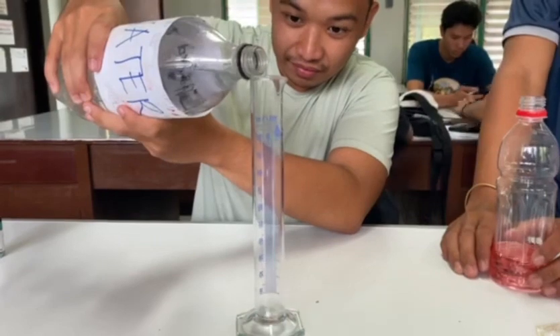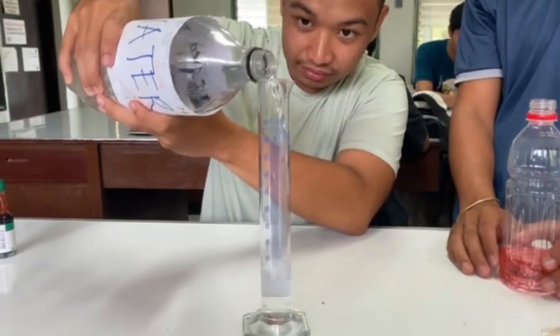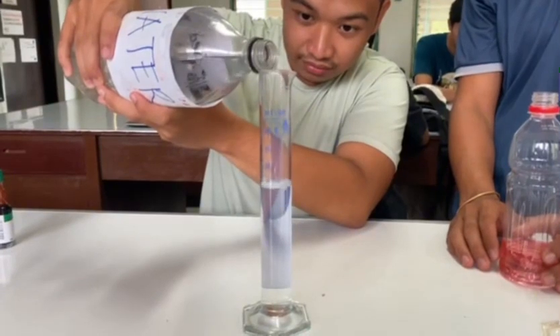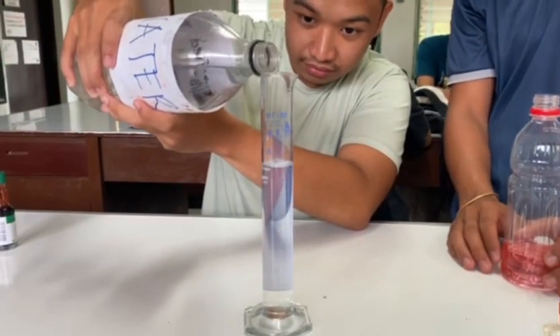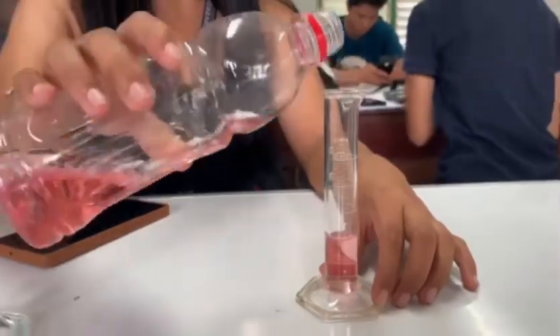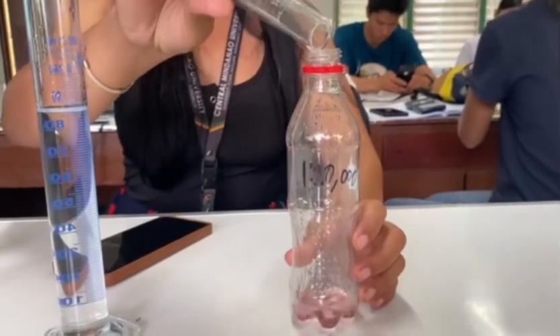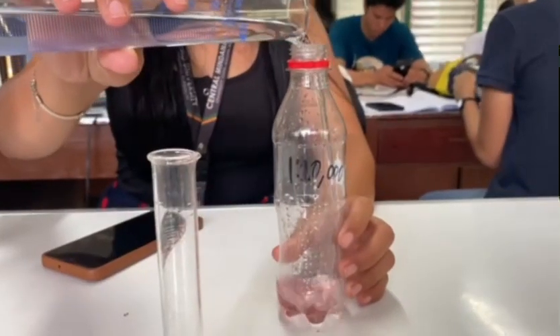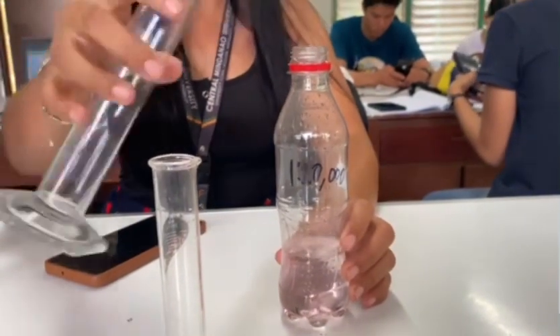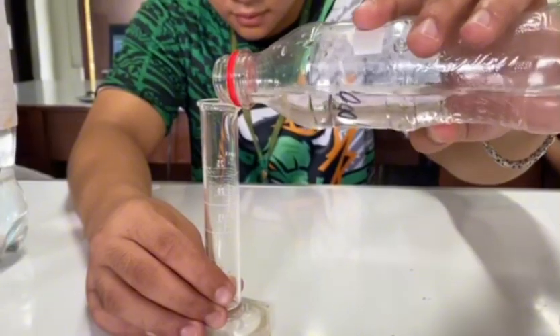And again, we take another 10 ml from the 1 to 1,000 dilution, or 1,000 ppm, and dilute it with 90 ml of water to get a 1 to 10,000 dilution, or 100 ppm. We repeat the process until we obtain a 1 to 1 million dilution, or 1 ppm.